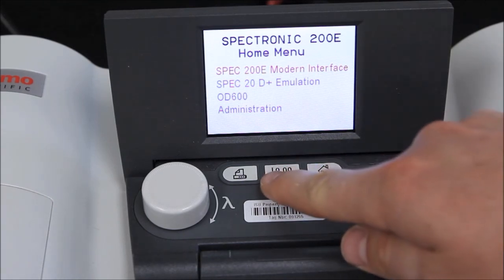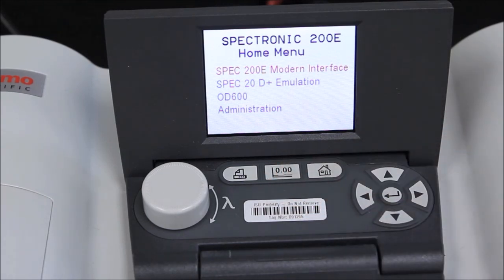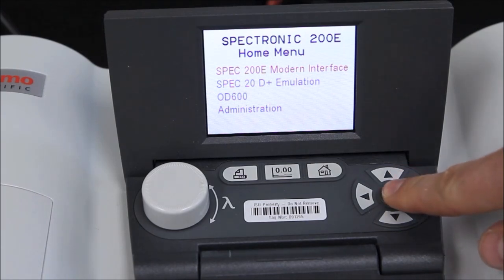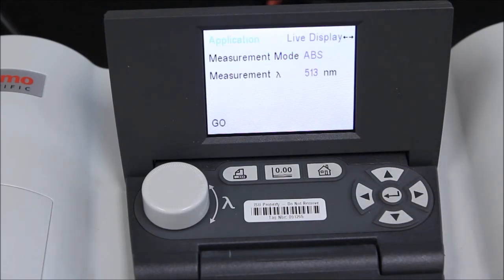We will use this button to zero the instrument with a blank solution. With the SPEC-200E Modern Interface option highlighted, press Enter to access the application menu.